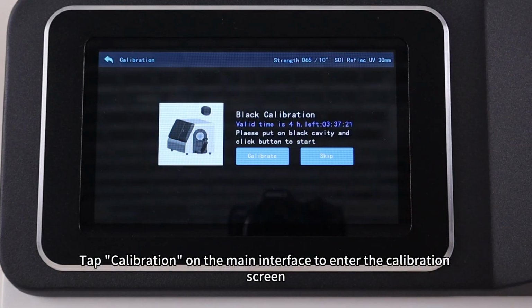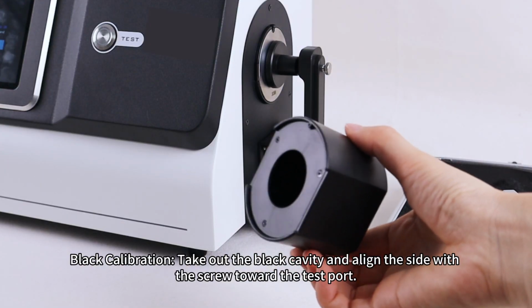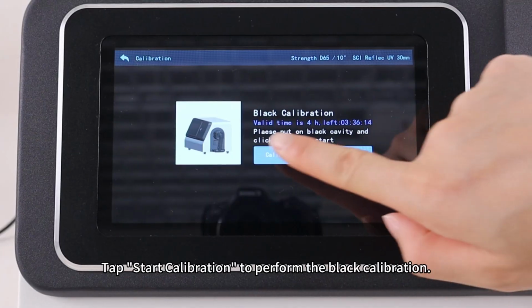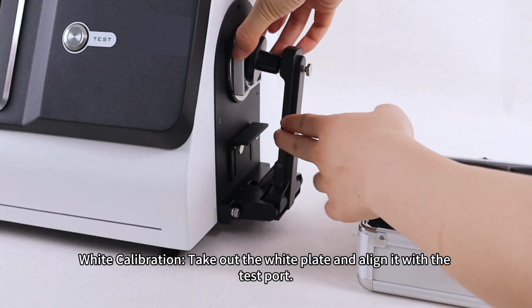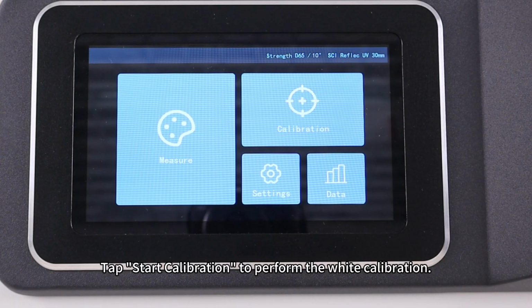Calibration. Tap calibration on the main interface to enter the calibration screen. Black calibration. Take out the black cavity and align the sides with the screws toward the test port. Tap Start Calibration to perform the black calibration. White calibration. Take out the white plate and align it with the test port. Tap Start Calibration to perform the white calibration.